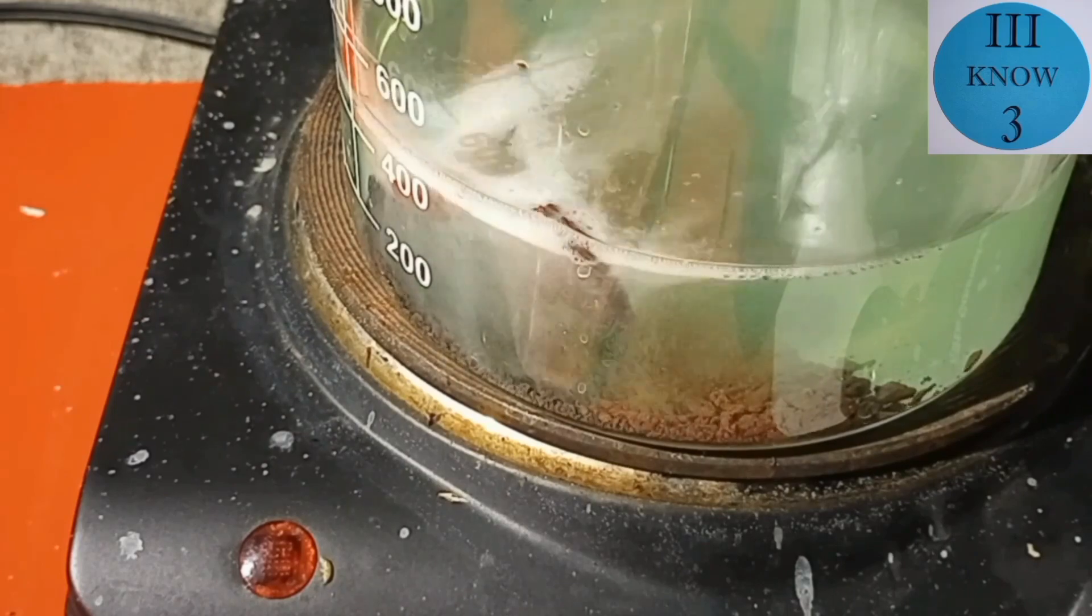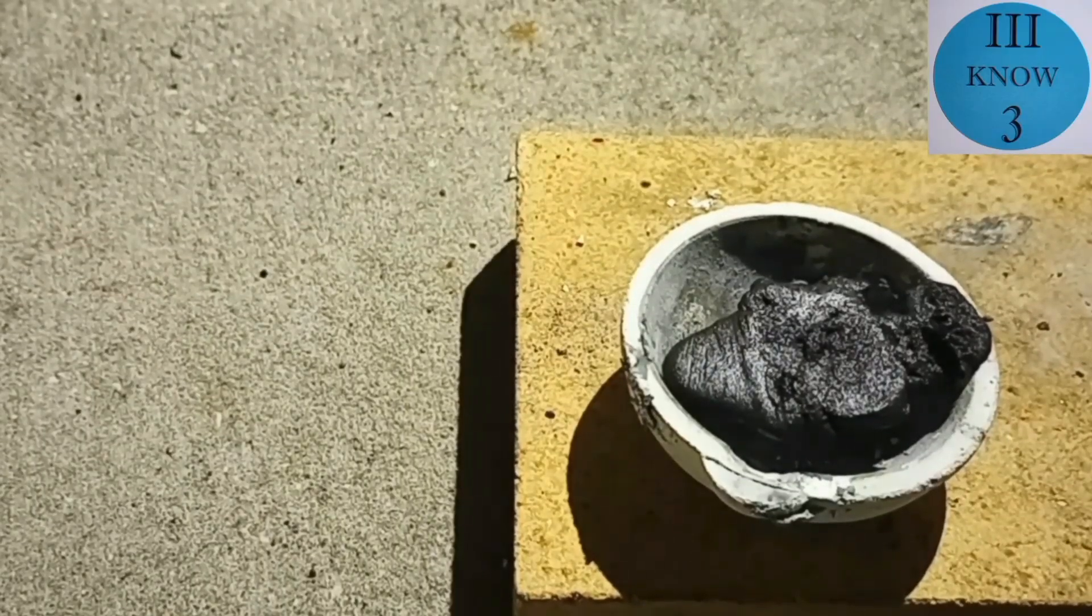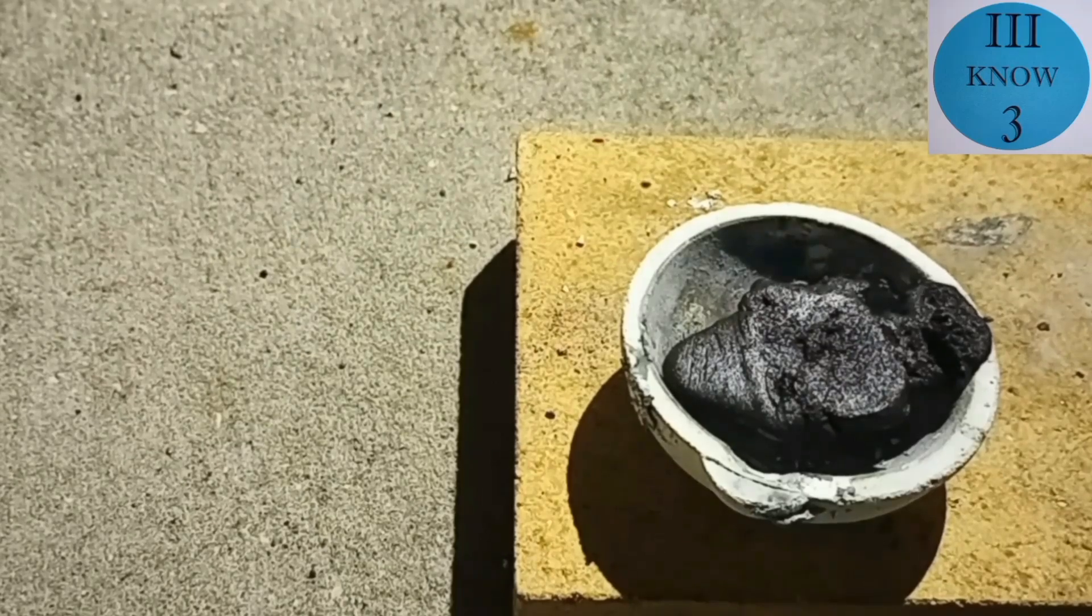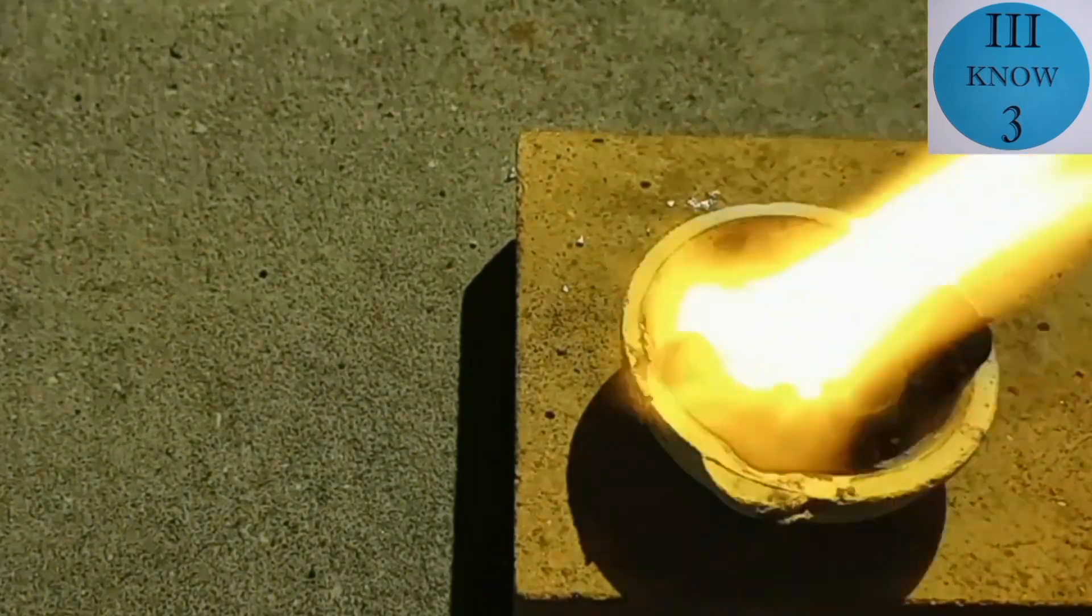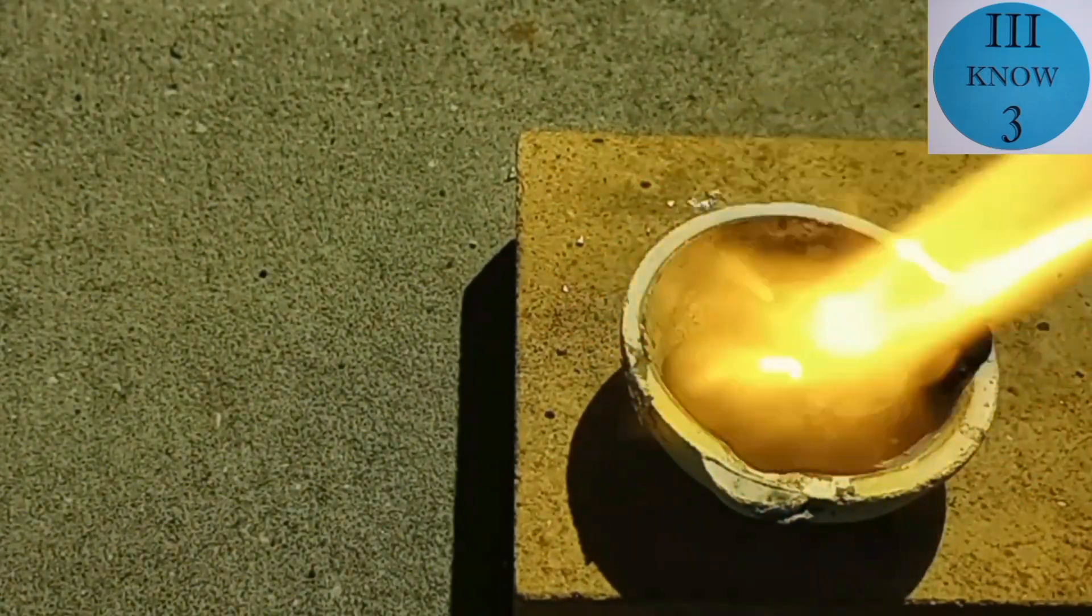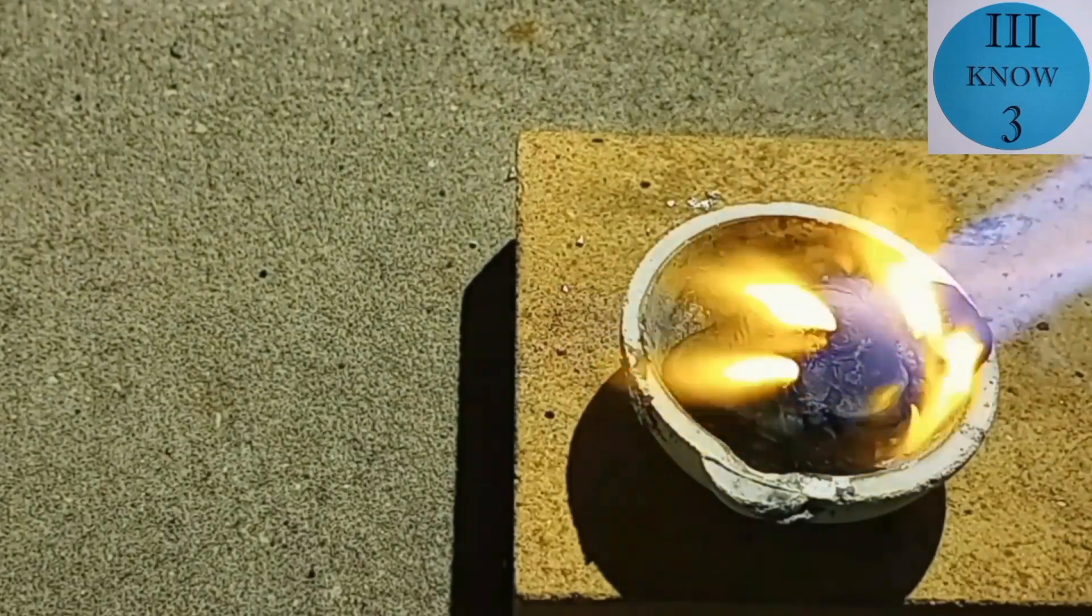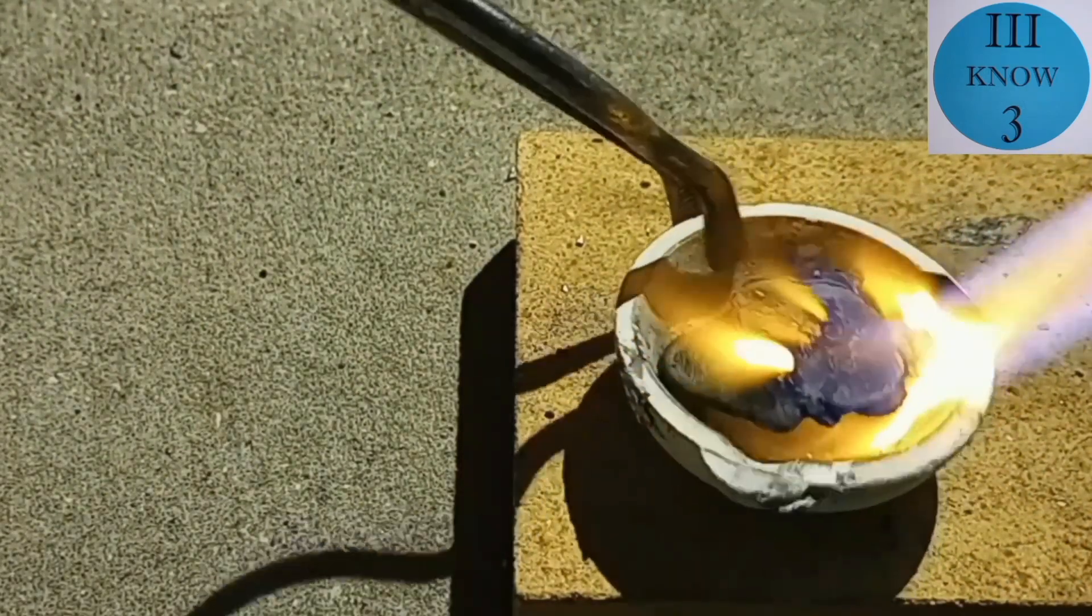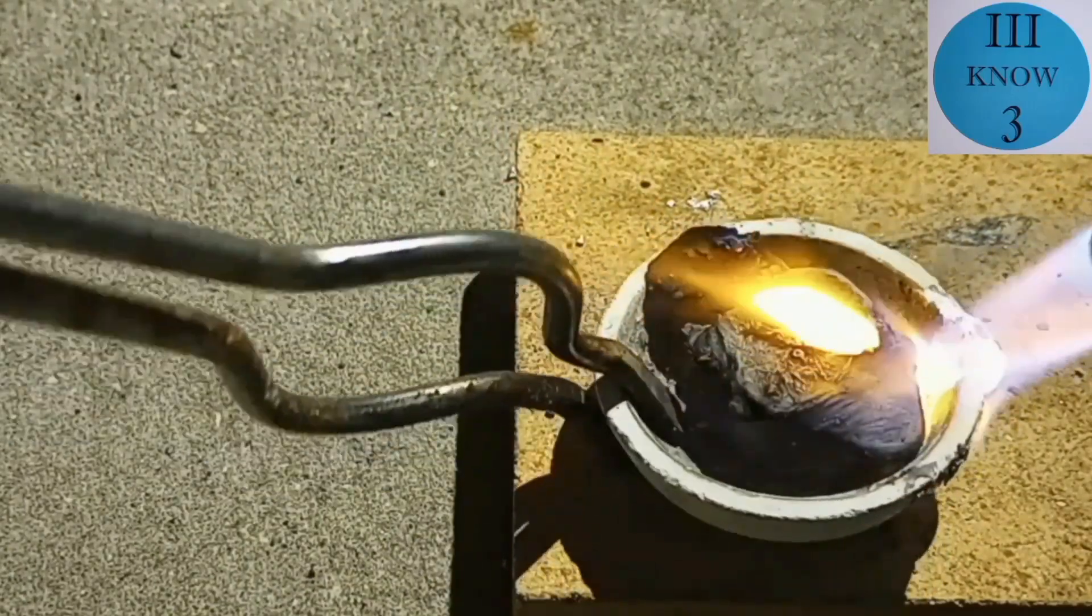So we wanted to see what was going on with the big piece of zinc. The black coating could be the nickel starting to plate out onto the zinc. So I thought if we tested it with fire we could accomplish a couple of things. We could expose some fresh zinc that will help continue the displacement reaction and we can see if that's really nickel or if it's something else.